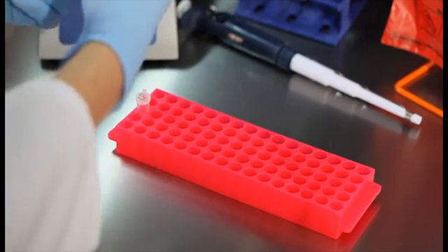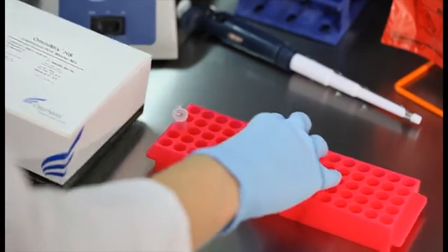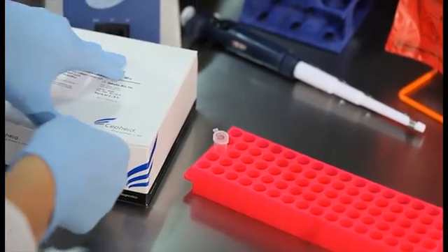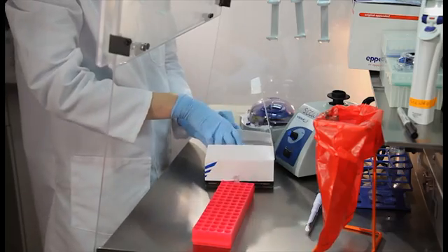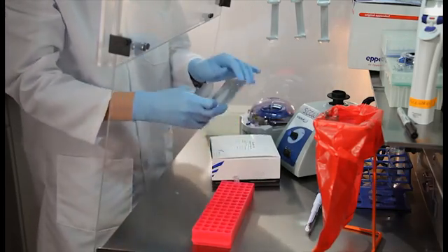Next, prepare the mastermix for the enterococcus qPCR assay. Repeat the process you used to prepare the mastermix for the specimen processing control assay, substituting the primer probe beads for enterococcus.